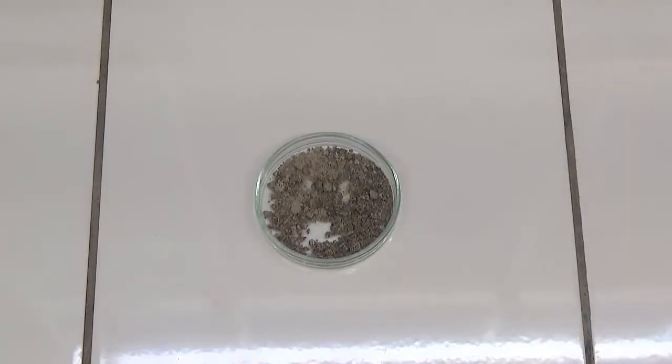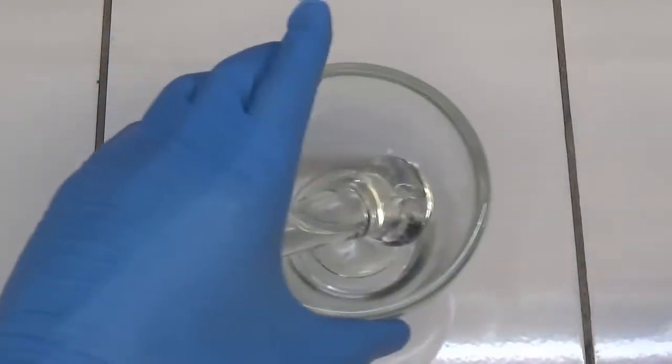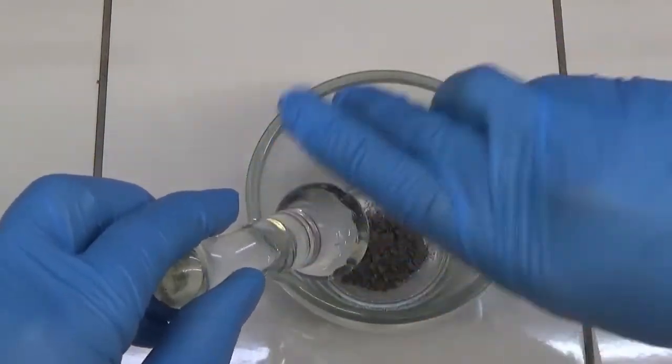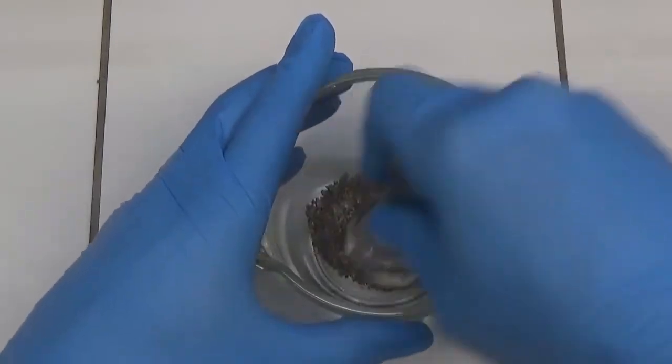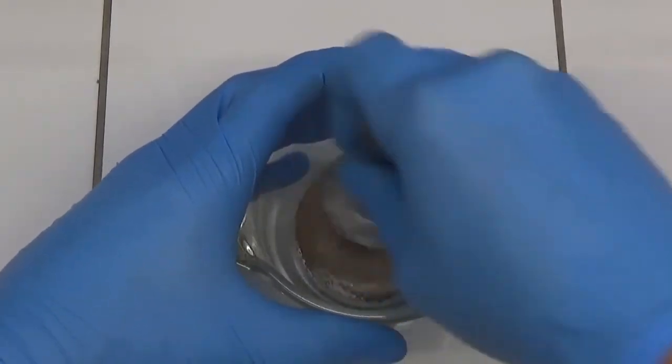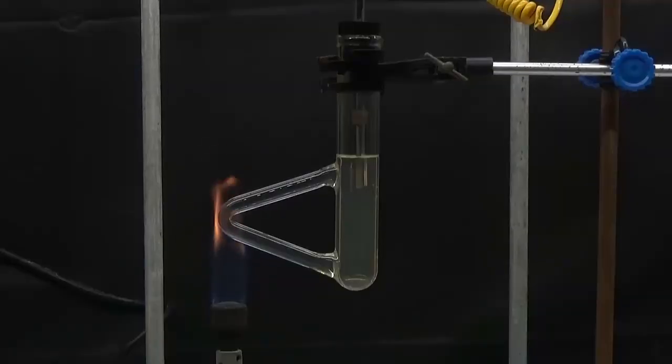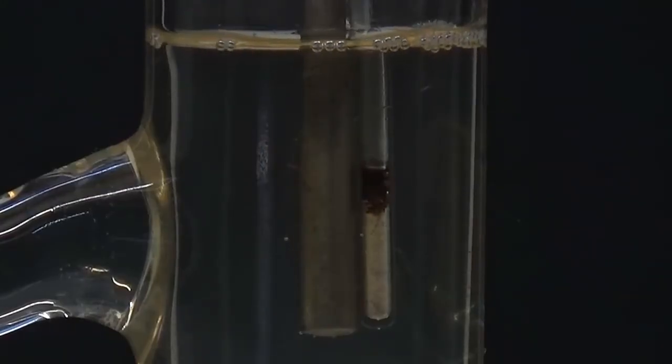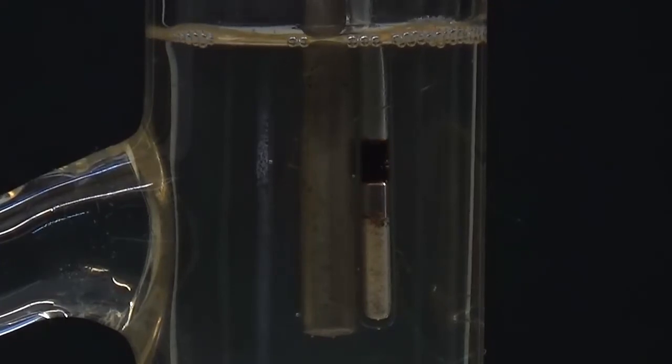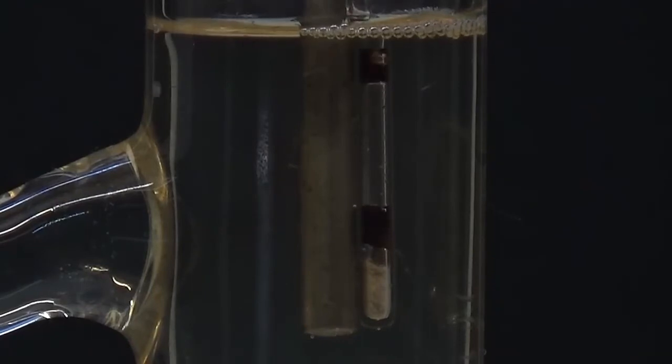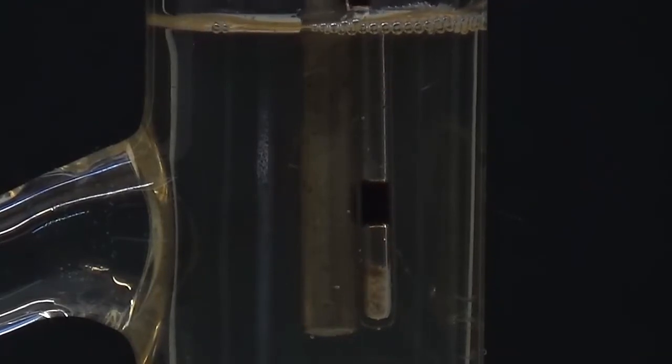We let it dry in an oven and grind to determine the melting point. The theoretical fusion point is 150°C and that obtained was 146 to 147°C.